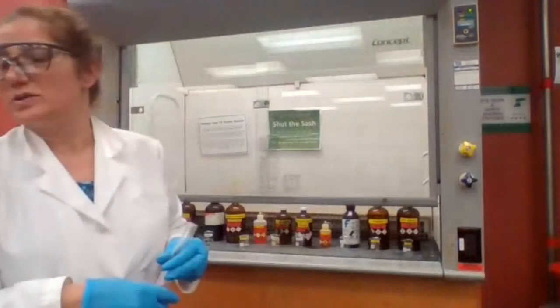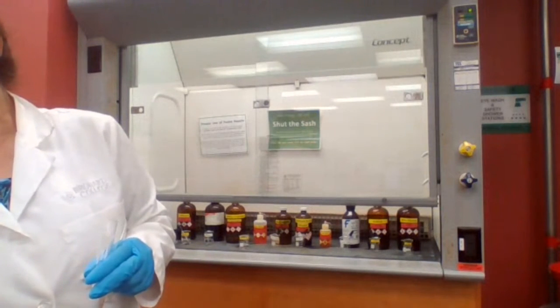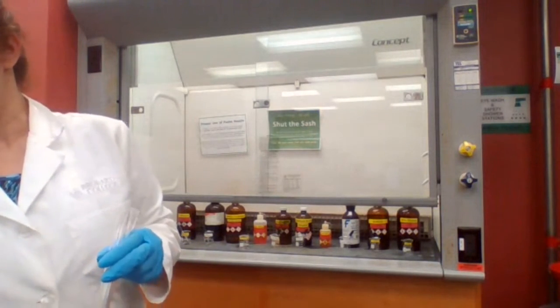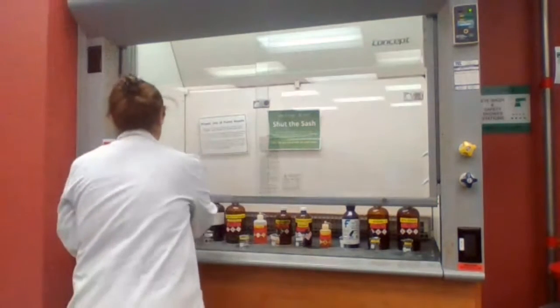So we are going to get the quantity, how much we're adding: 5 drops of the sample and 1 milliliter. Okay.